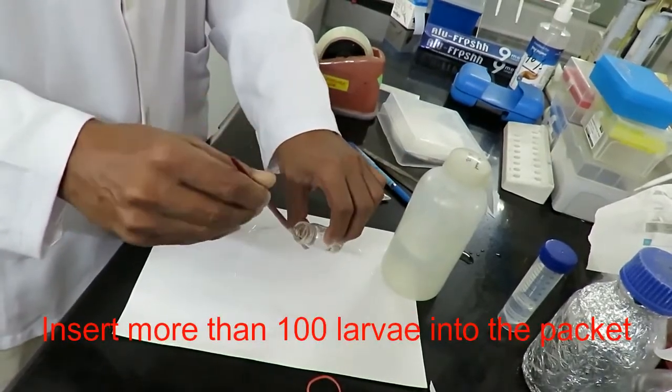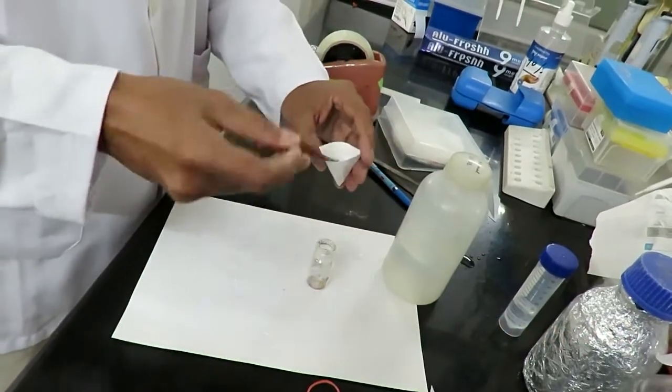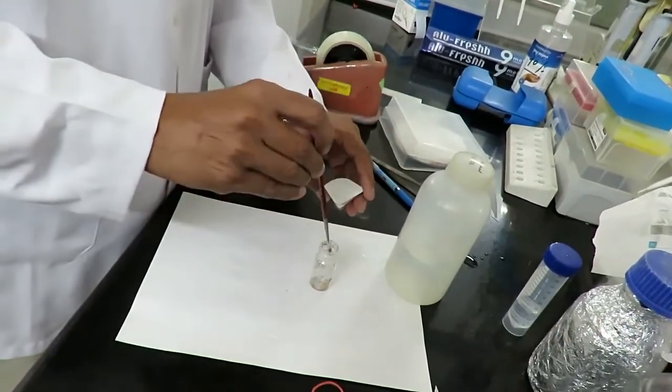And we will insert the larvae with the help of a paintbrush. Around 100 or more than 100 larvae should be inserted in each packet.